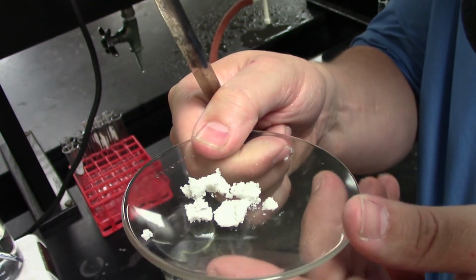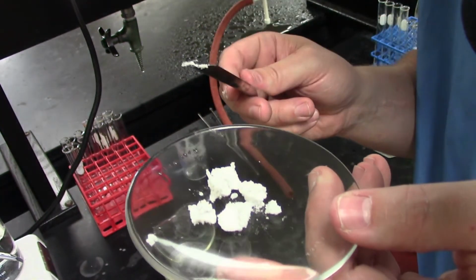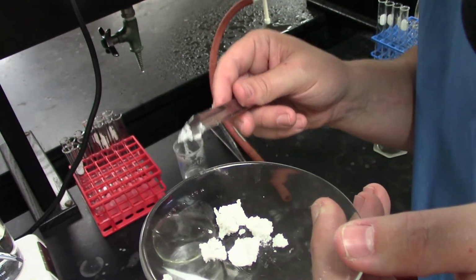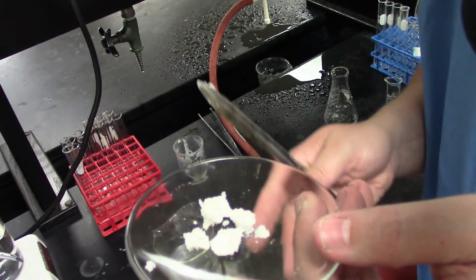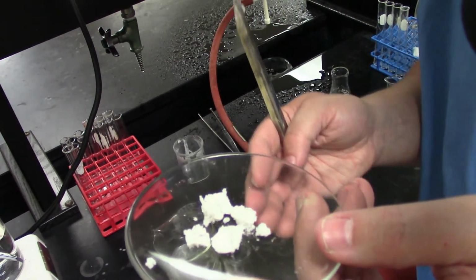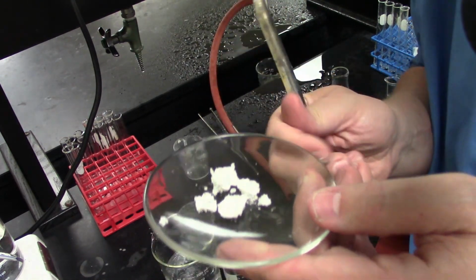It's actually a white, waxy solid. No strong odors. Again, our starting palm oil was a yellow color when we began. These white crystals here are a lot more consistent with what we expect to see. So next thing we're going to do is try a melting point, and we'll talk about that in a minute. This is a difficult thing to take a melting point of, but we're going to try to approximate it using a hot water bath.